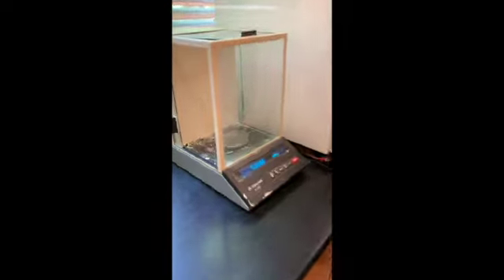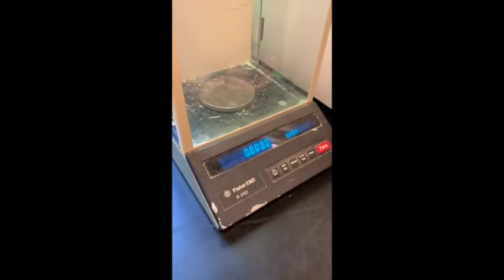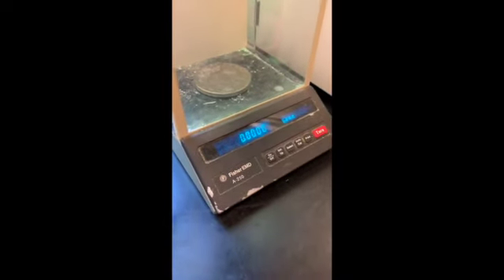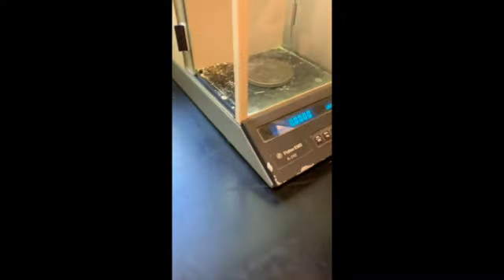This is an analytical balance that Maurice is going to be using today, and we use this for things that have a very light mass. It's already zeroed, we've already tared it. So Maurice is going to go through the side. As you can see, there's tops, bottoms. You can just go through the side and find the mass of his magnesium ribbon.